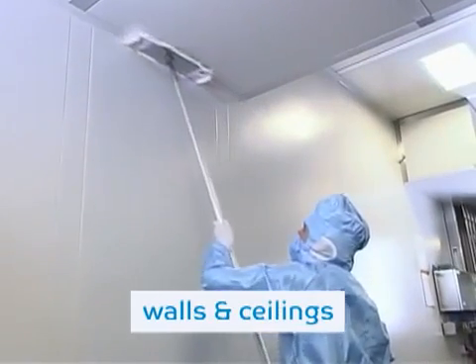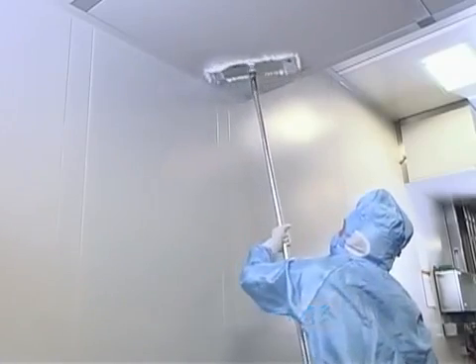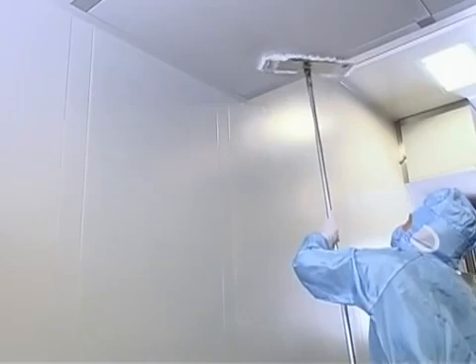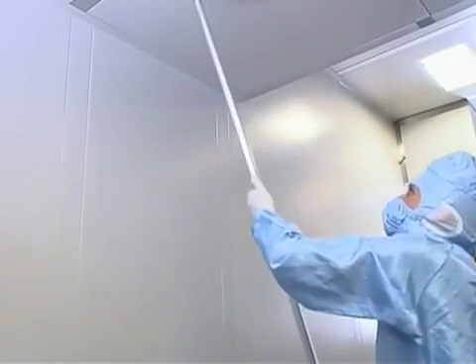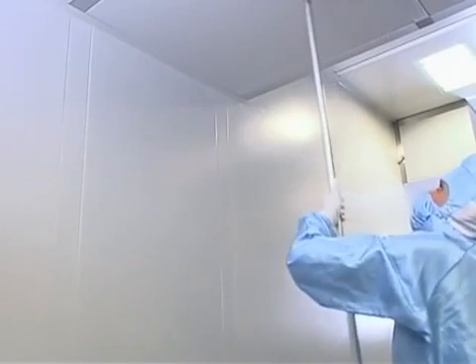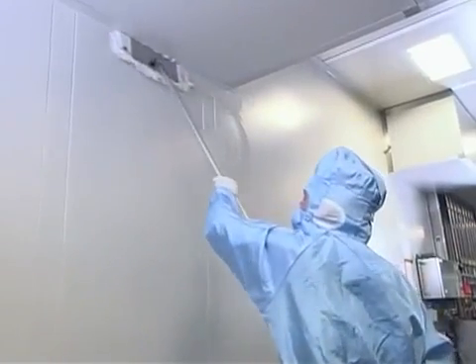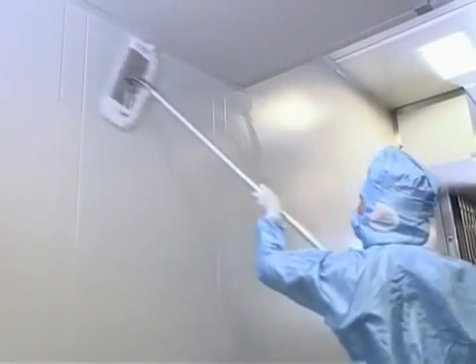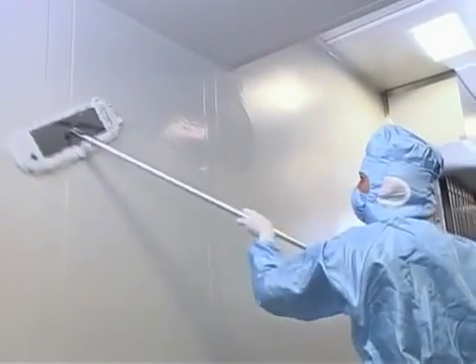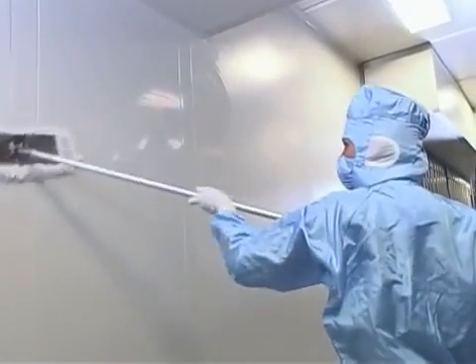Wiping the ceilings and walls, which are disinfected if necessary, is very similar to wiping floors. Elongate the telescopic handle of the mop as to enable you to easily reach every site. First, wipe the edges, and then wipe the surfaces in the shape of figures of 8. The person responsible for quality or hygiene in your company will inform you how often ceilings and walls should be disinfected. Basically, the following order should be observed for the disinfection: ceilings, walls, floors.